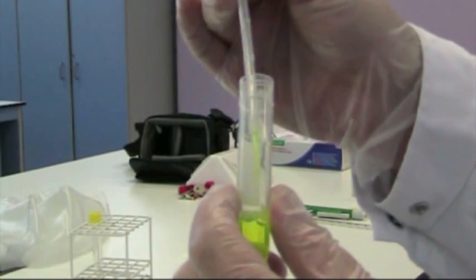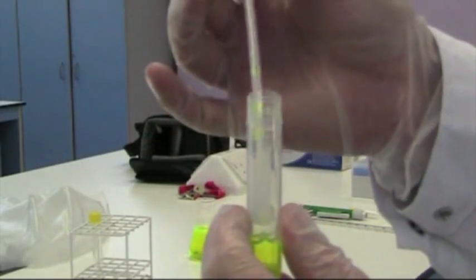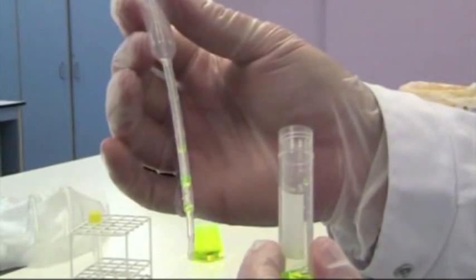If I squeeze it like this you can see not only does it shoot onto the top, which is why I'm wearing gloves. There's droplets around the edge of the vessel and there's also droplets still inside the pipette which isn't very accurate.